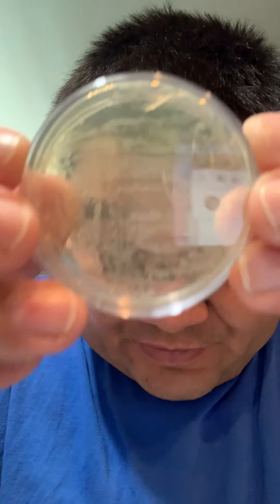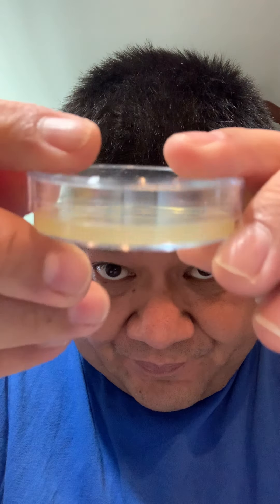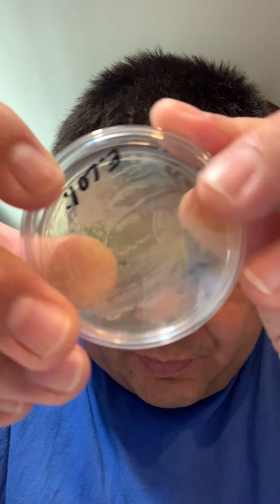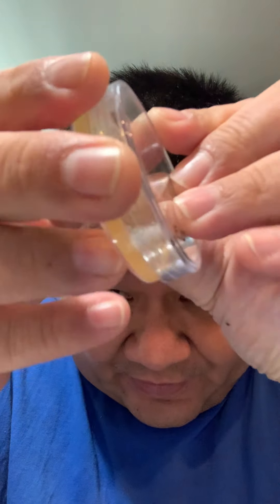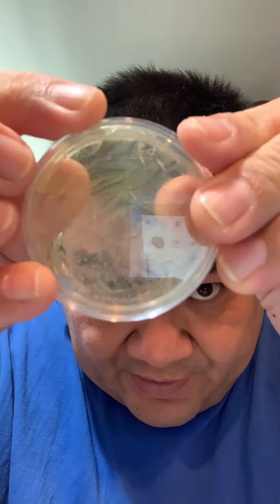During my experiments with the plate, I noticed that my first one was E. coli. Here's my E. coli specimen on my plate — I even labeled it. Here's the front, and here's the back of it.